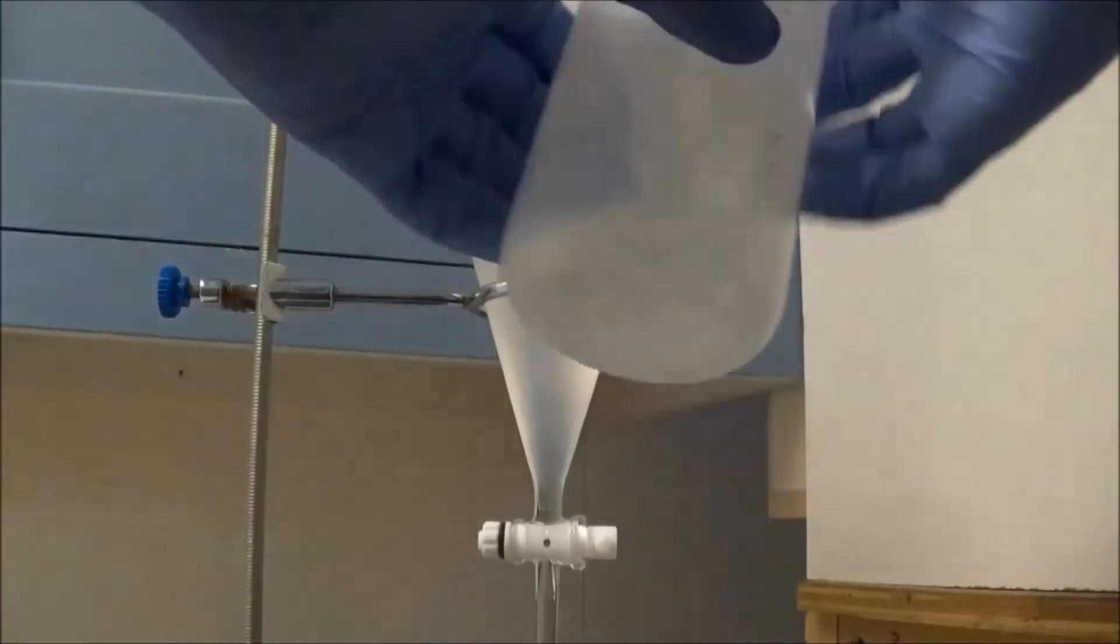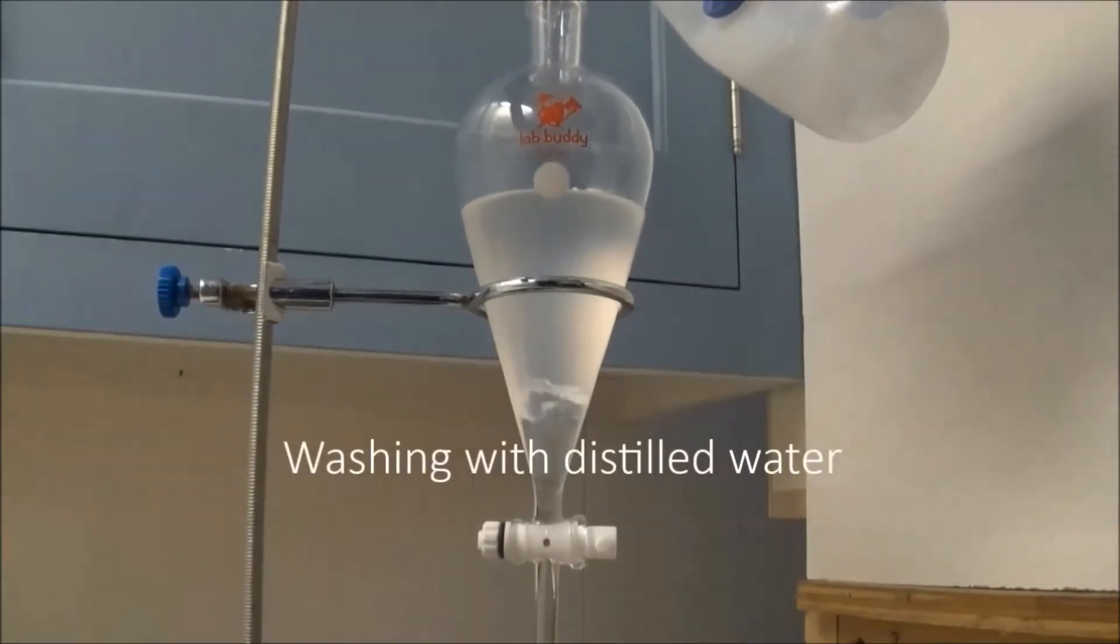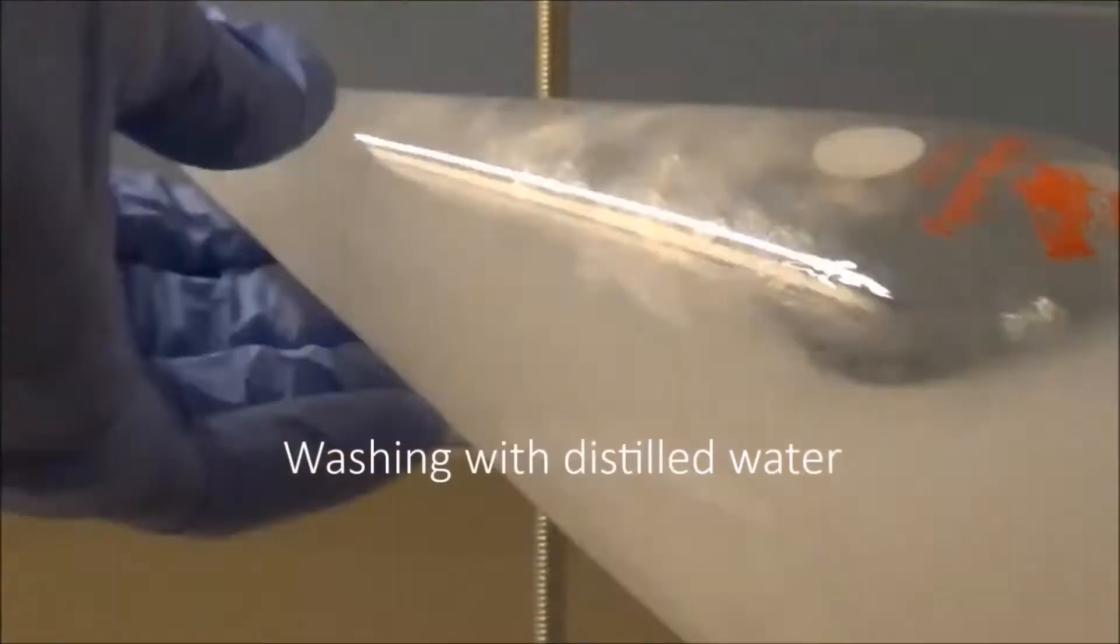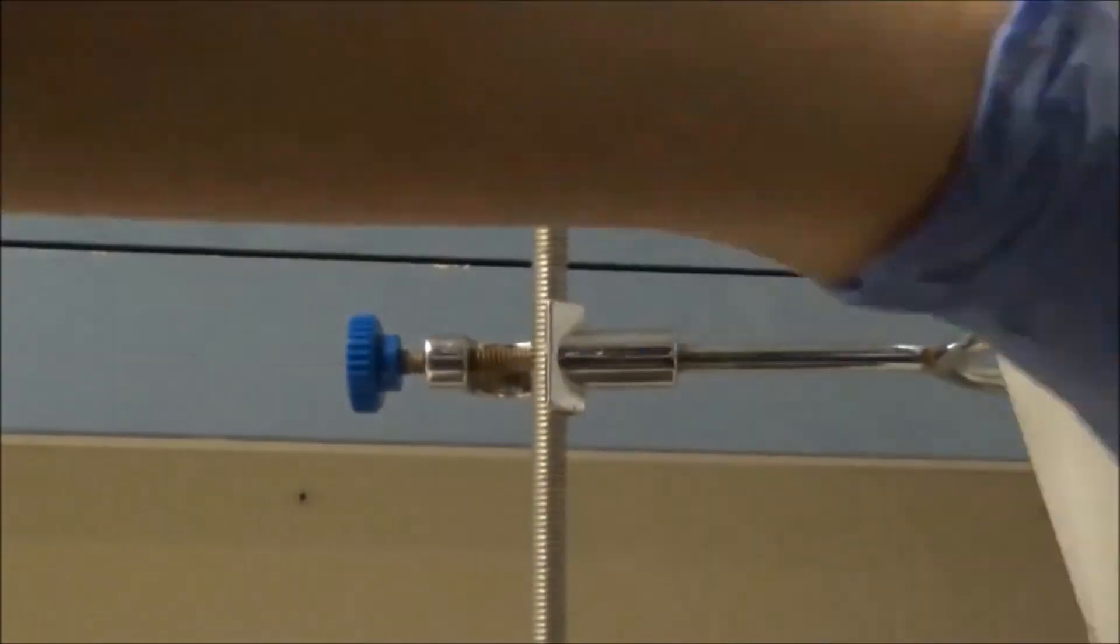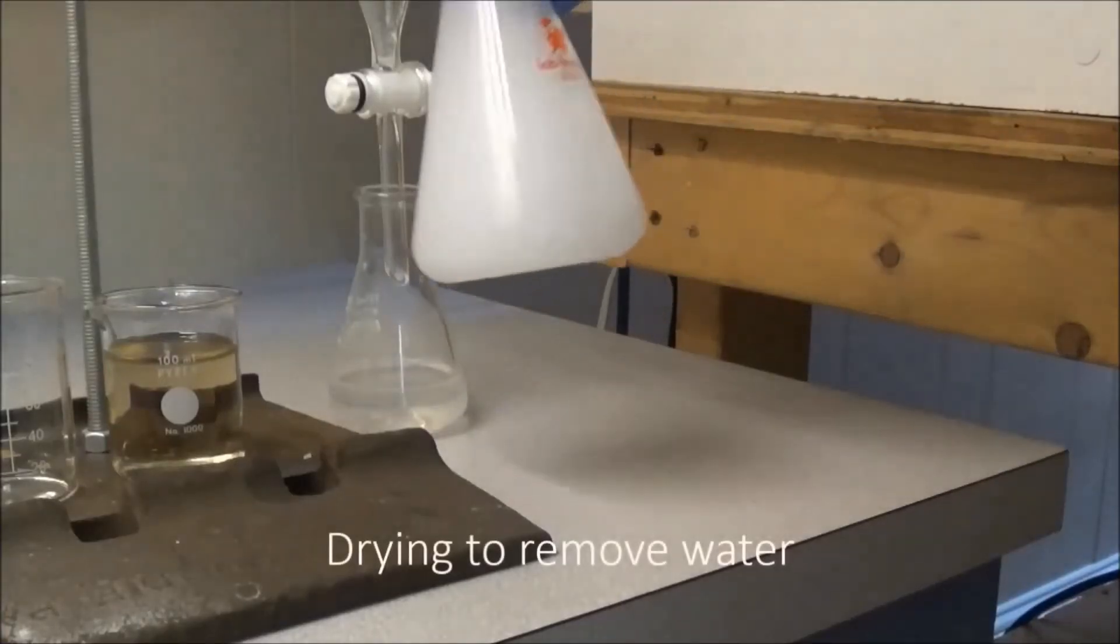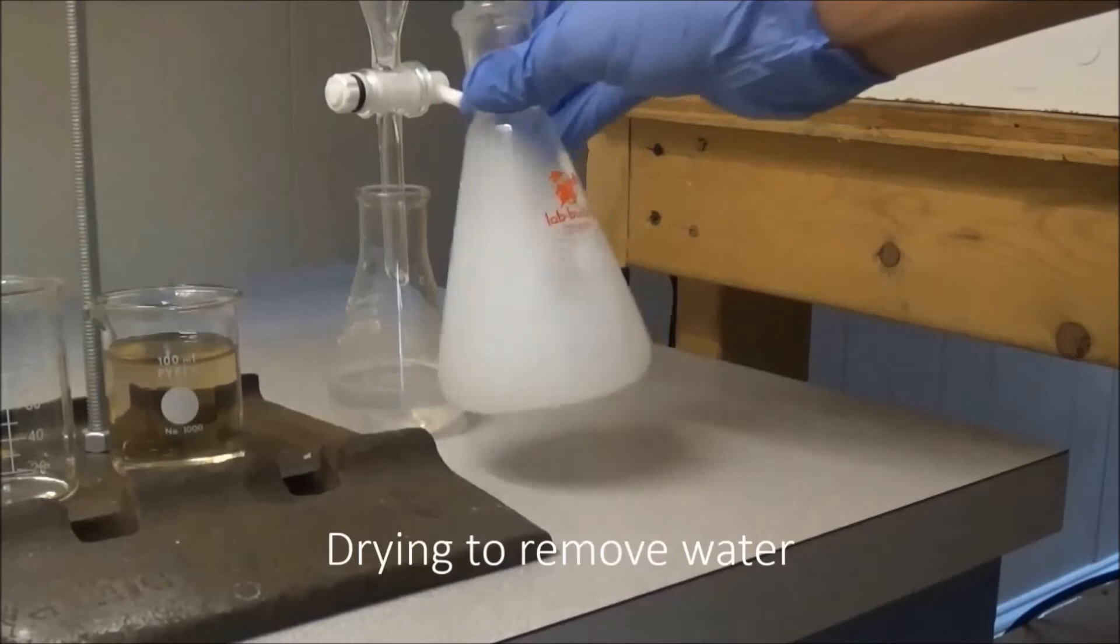Next, I washed the toluene twice with distilled water. Drying over anhydrous potassium carbonate should clear up the toluene.